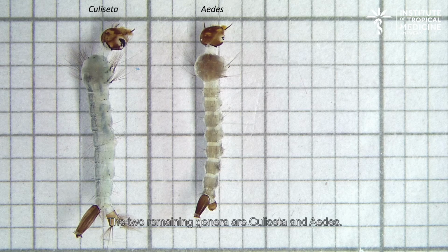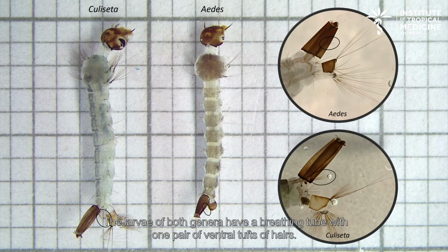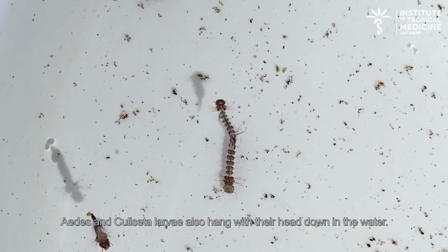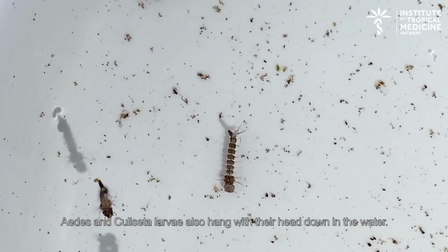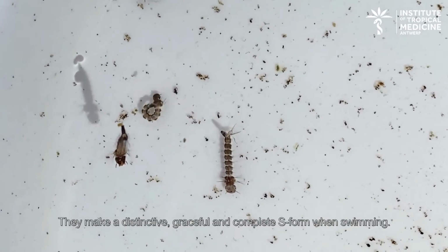The 2 remaining genera are Culiseta and Aedes. The larvae of both genera have a breathing tube with 1 pair of ventral tufts of hairs. For this characteristic, a loupe or stereo microscope is needed. Aedes and Culiseta larvae also hang with their head down in the water. They make a distinctive, graceful and complete S form when swimming.